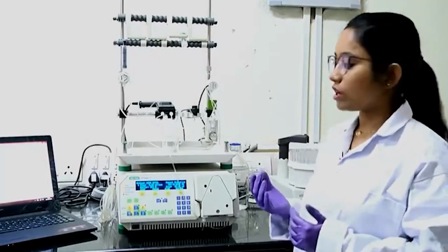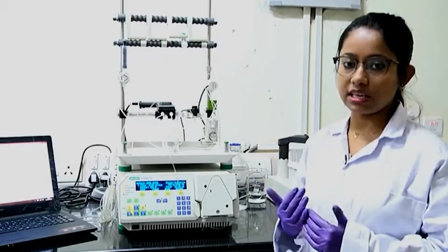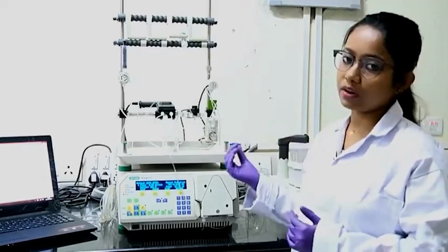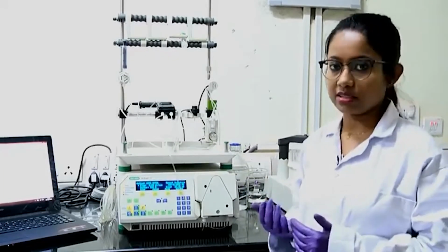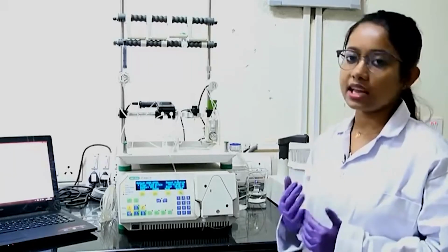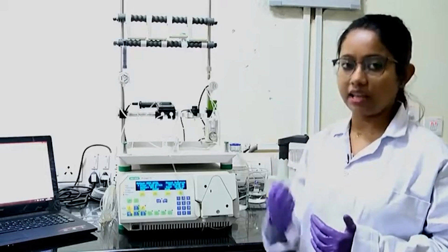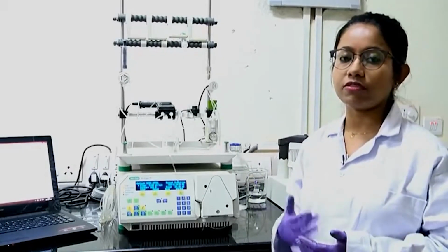So, for that you need to pass through EDTA. EDTA will remove all the nickel ions. While you pass EDTA, it will chelate the nickel ions and remove them. So, you will end up with only the NTA beads or agarose beads, which do not have the nickel ions. Then after you remove all the used up nickel ions, you have to regenerate the beads using nickel sulphate. Nickel sulphate has these nickel ions, which will get chelated again in the beads, and then you can use the column for future use.